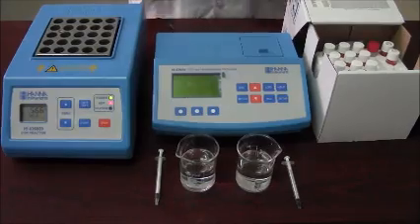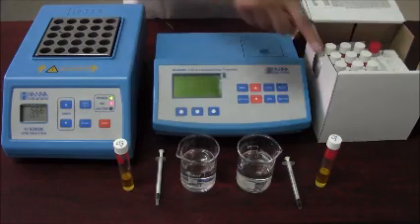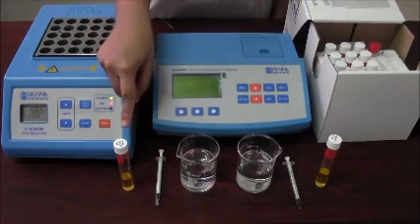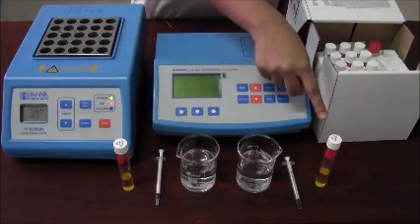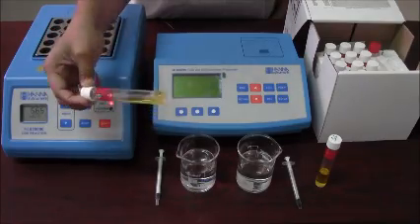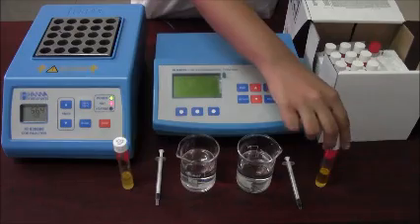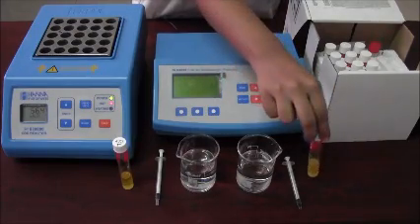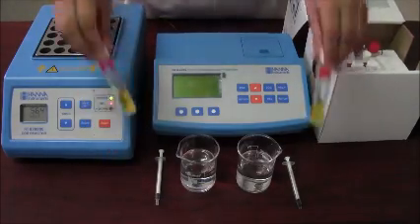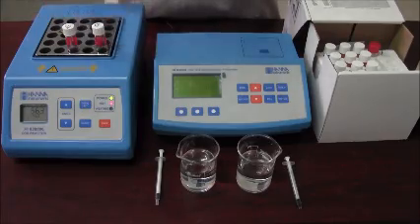For low range COD you require two reagent vials — one for the blank and one for the sample. In the blank vial you have to add two ml of deionized water. In the sample vial you have to add two ml of the sample. Gently mix both the vials while inverting at 45 degrees. Be careful while mixing as the temperature of the vial increases. After this step is performed, place both the vials in the COD reactor for digestion at 150 degrees Celsius for two hours.